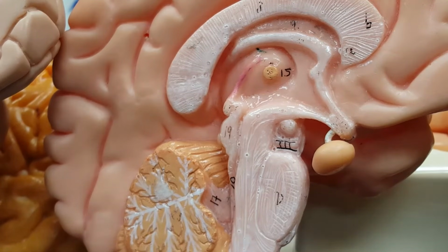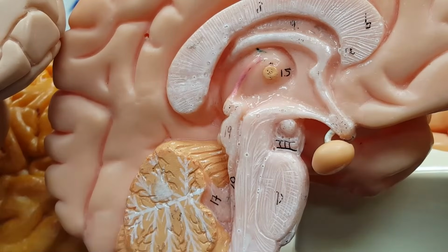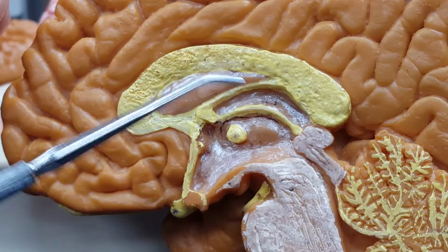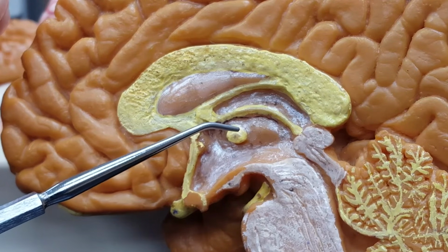Do you notice how close together all these things are? On a three-dimensional quiz, live in person, kind of tough to tell where the dot and the arrows are. On this online quiz, I can put a dot exactly where I want it. So make sure you're going through this instructional video enough times to know what it is that you're looking at. Another brain. So notice I like to use as sort of an anatomical landmark this intermediate mass, which is usually differently colored.